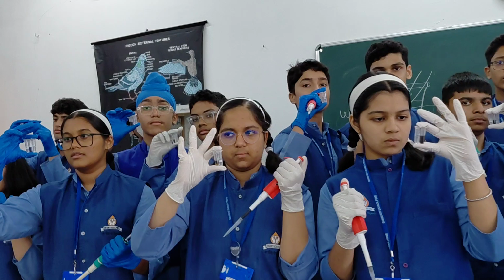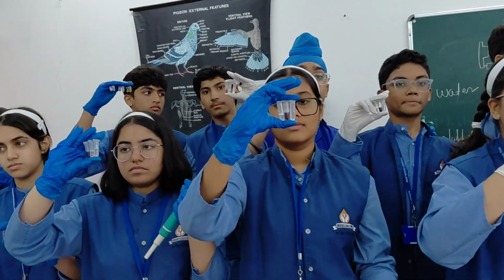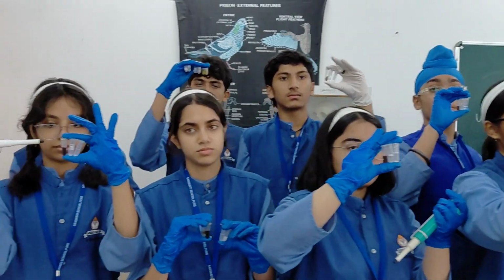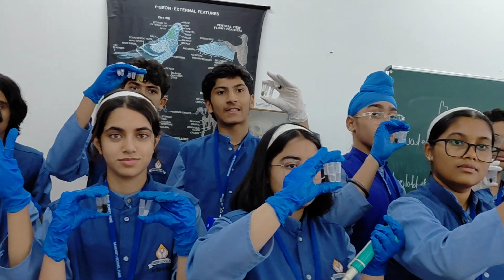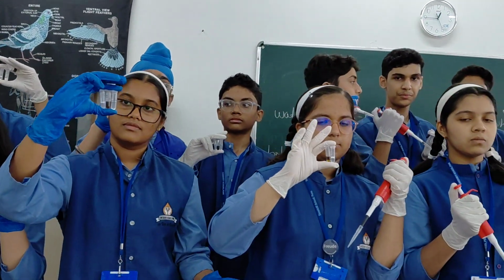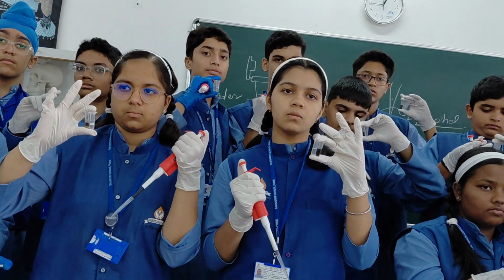You are at the stage to see the DNA by adding alcohol. That is called the DNA precipitation step. Just within 2 minutes you will see the DNA of hair, saliva and plant. Clear? This top layer liquid contains DNA and RNA that come after protein precipitation.